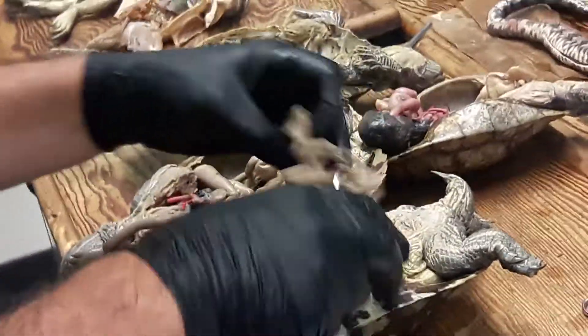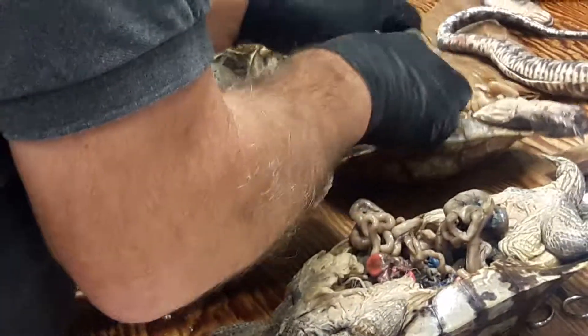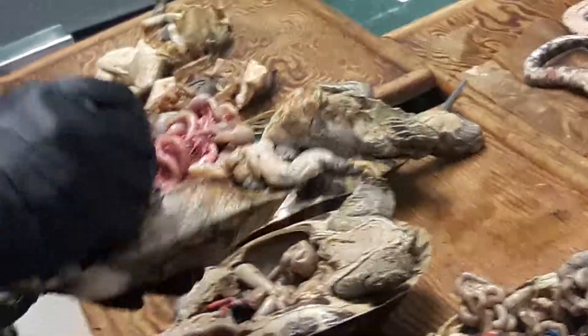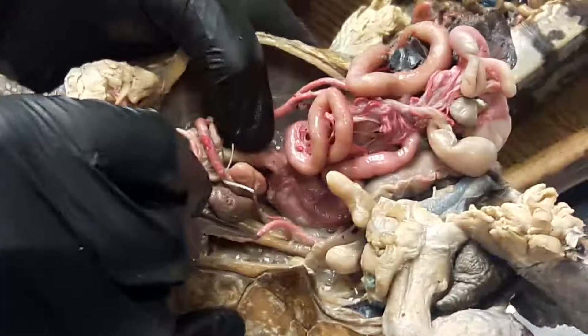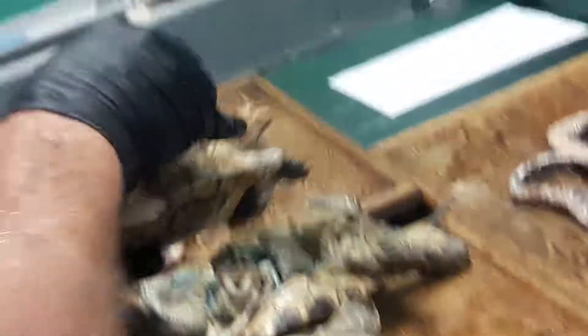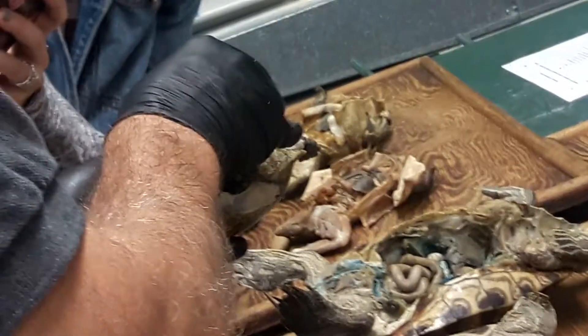In one of these turtles I think we could actually see how those joined together, coming all the way down to become the dorsal aorta. The left systemic got torn where it came in there, but you can see a little remnant of it there.